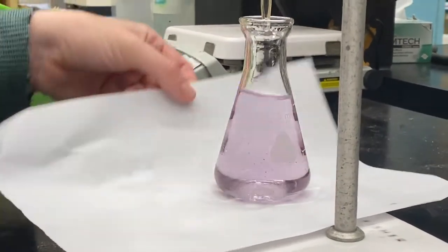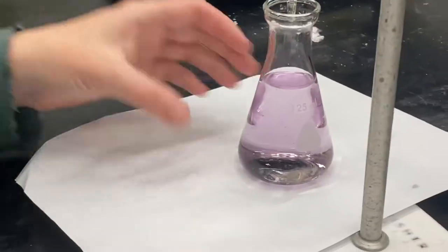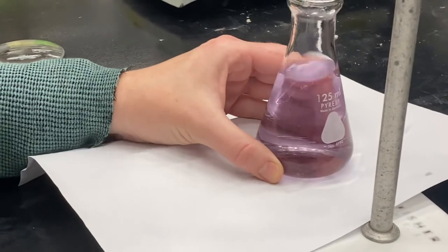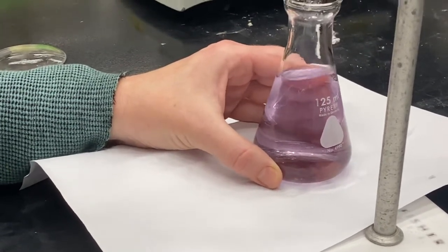All right, so as you get closer and closer to the endpoint, I can see that it went from a pink to almost a purple. So I know I'm really, really close. You want to obviously slow down, but the next thing is, you don't want to over titrate.